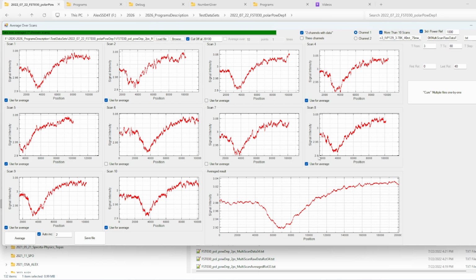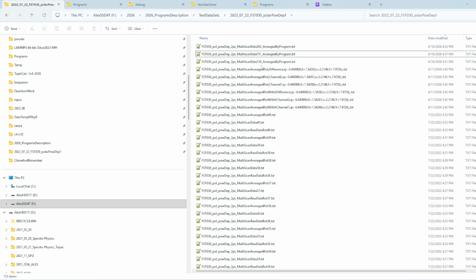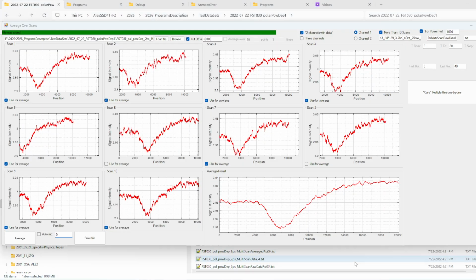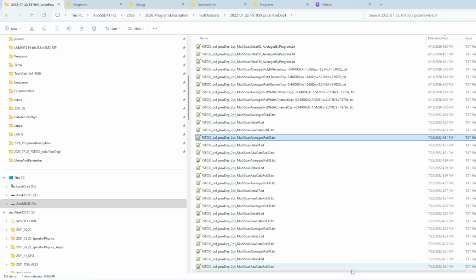And the same, if I choose I don't want this, I don't want that, I want this, I click save, and after I save, the counter automatically goes from 2 to 3. So you see it's automatically 3. Another thing that is important to know is that here my old counter stays. Generally, you don't want to use auto increase, you want to resave everything with 0. In this way, when you then use the text shuffle on nematicity, you use the old counter. For example, here it was 15, here it will be 30. And that's it. After you average by program, then you use this averaged by program file. If you need to average not all files, but only 2 or 3, then you need to rename the file with average load, so all files have the same structure.